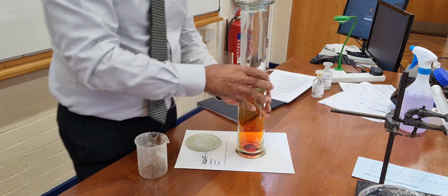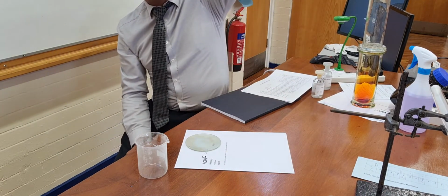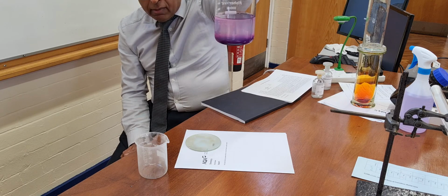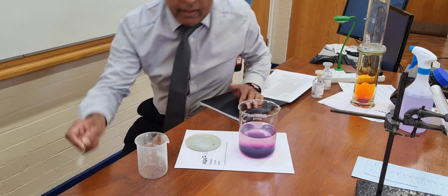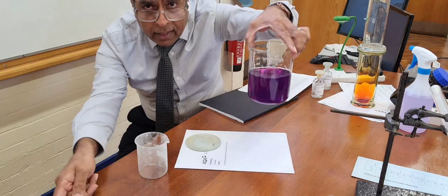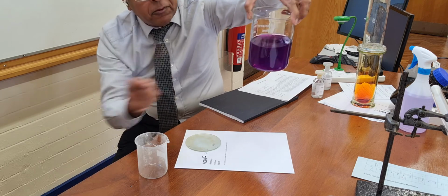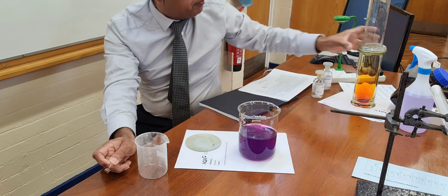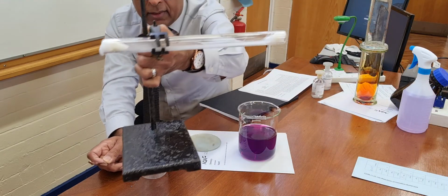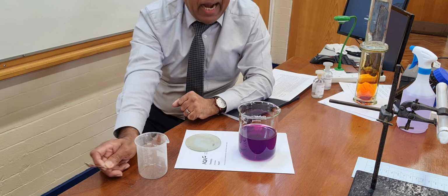And if I look at the first demonstration I did, this one, then you can see the purple colour is more at the bottom, very faint at the top. And you're going to have to trust me that if I was to leave that a week, then it would look like this. It would look, after a week, like that, because all the purple particles would have spread out throughout the beaker. The particles of a liquid spread out slower. The particles of a gas spread out faster. And light gases, low density gases, they diffuse faster than heavier, higher density gases.